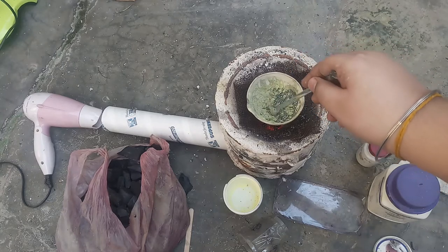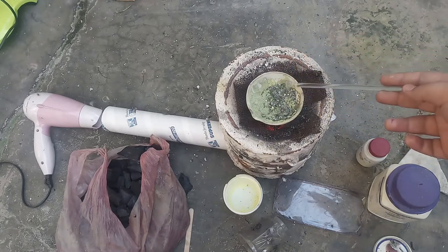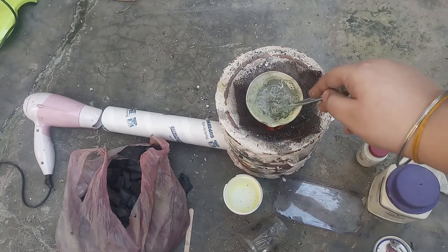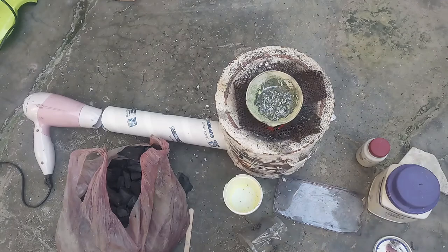The sulfur has a melting point of 115 degrees Celsius. It means it's all been reacting. Be careful about the gas being produced. I am doing this outside; you can also do it in a fume hood.